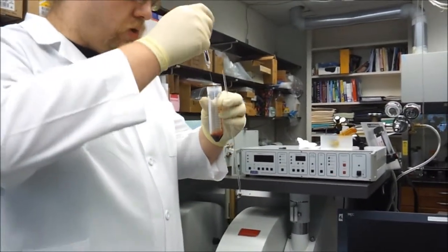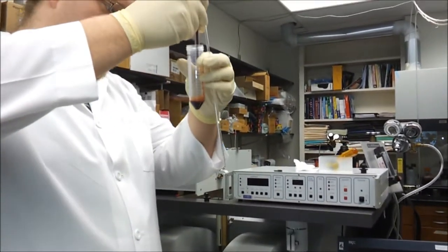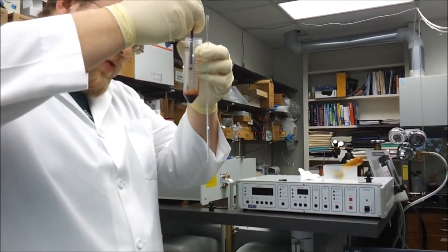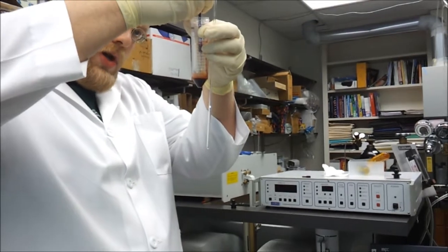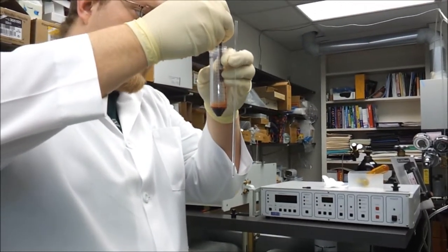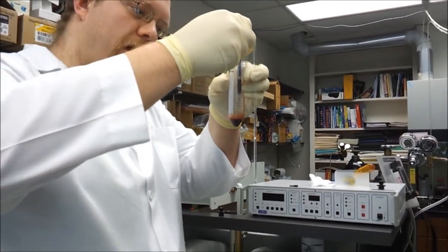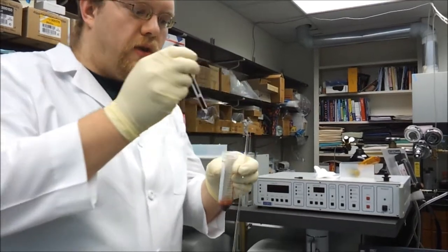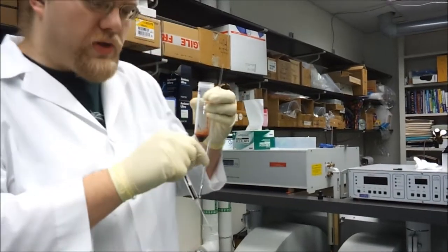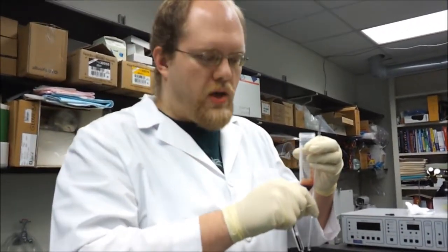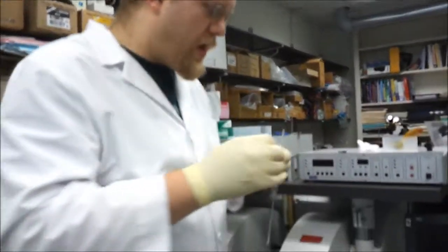We have our sample, just some old blood. With a syringe you want to draw up about 400 microliters, 0.4 mils. Want to be careful not to use more than this amount, because if the sample goes up too high in the tube, then once it goes down in the spectrometer, the top part will start to thaw and melt and can interfere with the signal down at the bottom.